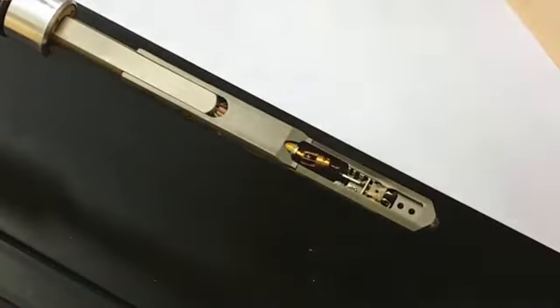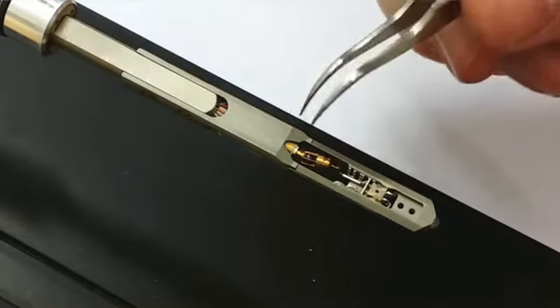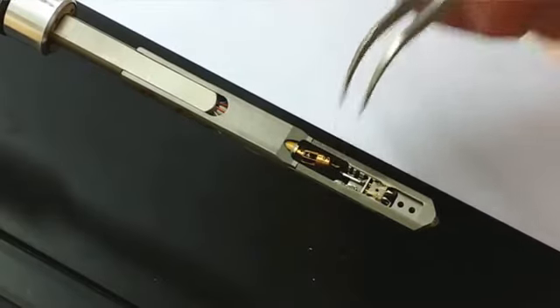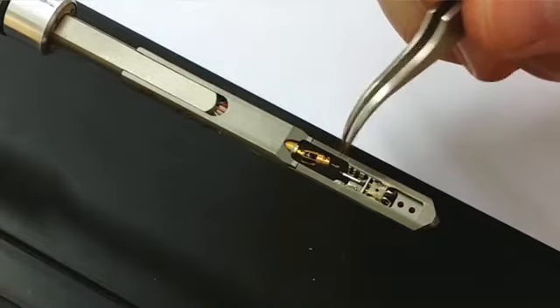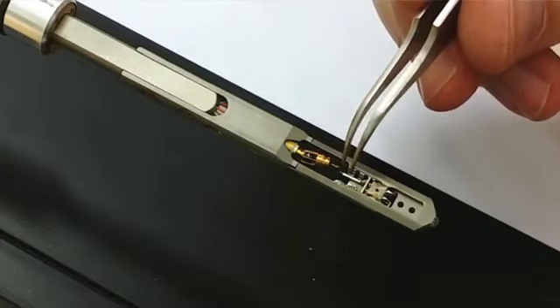This is the final sample holder that I'm going to show you. This is a much more advanced one. Here you have actually a moving probe on top of here. With this probe you can in situ probe and contact the materials. Here you don't use these grids, but the sample is instead glued to a small metallic wire that you see here in front of the holder.